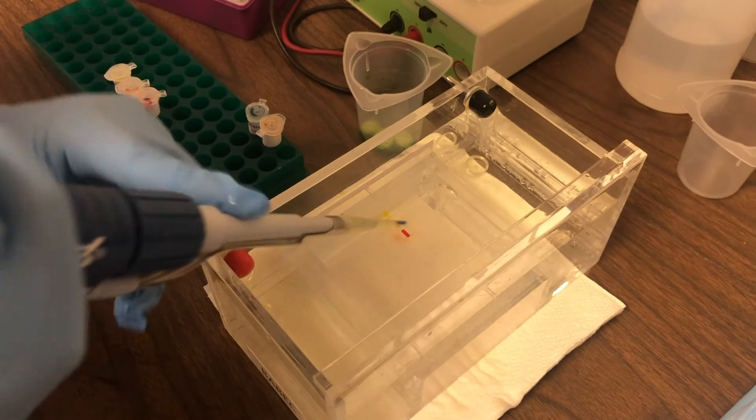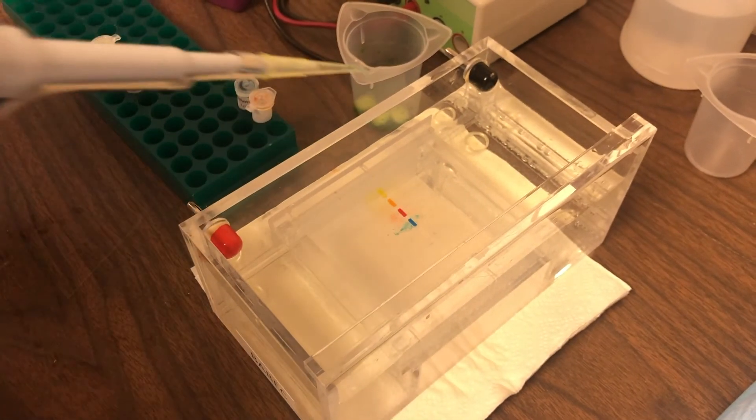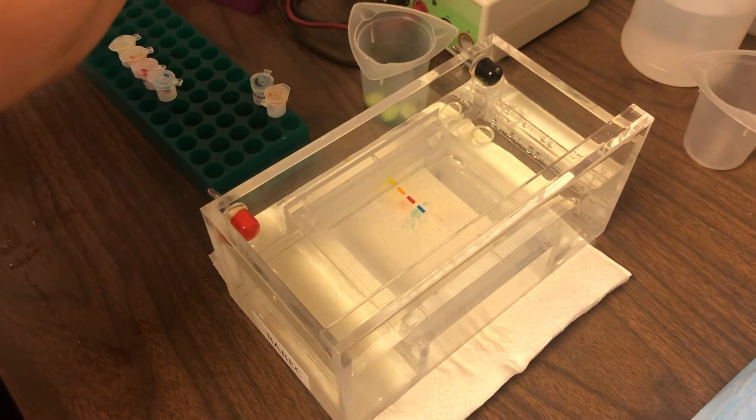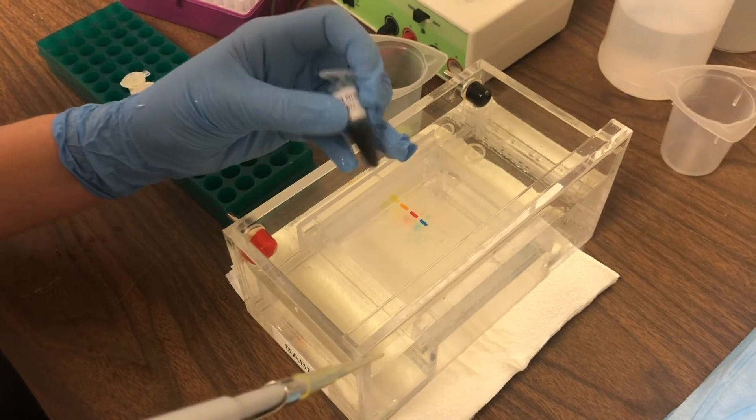Now, sometimes there's a little bit of liquid on the outside of your tip and that comes off into the gel. And it looks like, oh no, I may have missed making it into the well. So, don't worry if that happens.